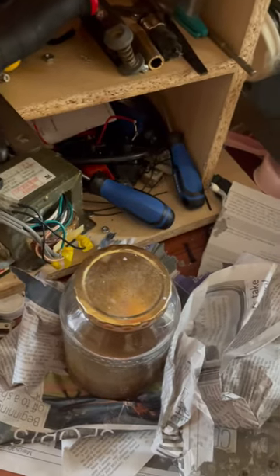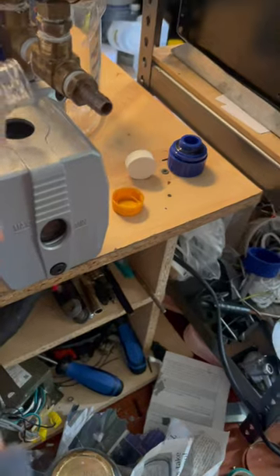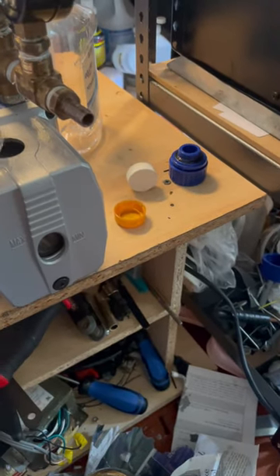by washing it up with some acid and a base, and then drying it. But mineral oil is cheap, so I'm just going to put this in.